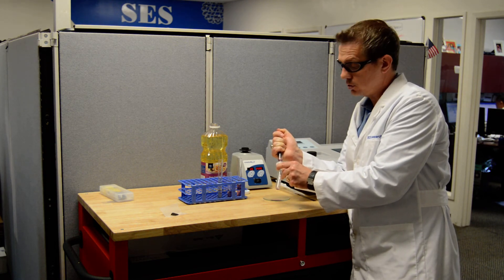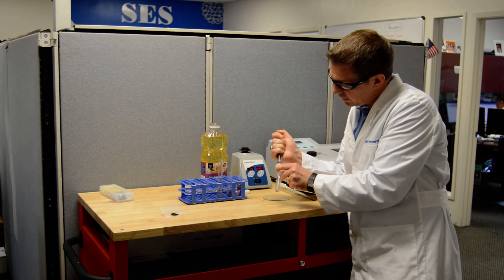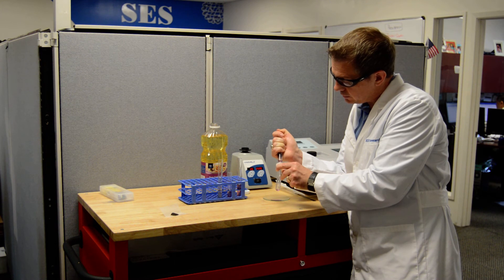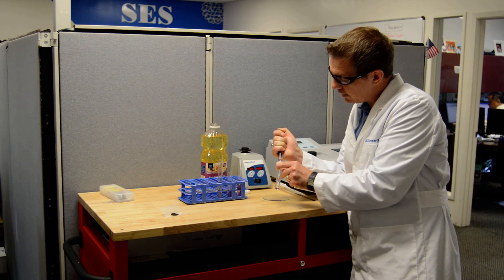Let's say you had sugar and sand together. When you filter that sugar, sand and water mixture, the sand would stay on top of the filter and what actually dissolves in the water would go through the filter. As you can see this is coming out, it's the same purple color so no real surprise there. Let me get a little bit more out here.